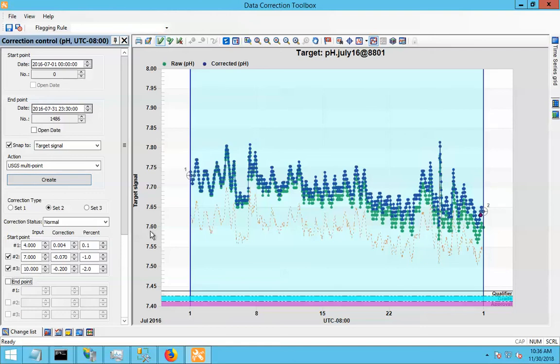Now, what I've put in here, and the effect of this correction, is to say that if a value was at exactly 7 pH, we're going to apply this much correction. If a value were exactly at 10 pH, we're going to be applying a lot more correction. And for any value in between, between 7 and 10, we'll apply a corrective factor somewhere between these two values. So in effect, the amount of correction that the software is going to be applying to each of your points is going to depend on the value of the point itself.